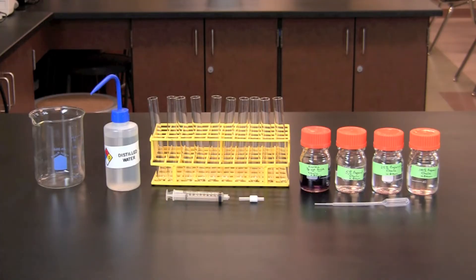In this activity, you will take solutions containing different percentages of alcohol and use these solutions to separate colors of Kool-Aid on a chromatography column. This is made possible by using differences in the polarity of pigments, the chromatography resin, and the alcohol solutions.